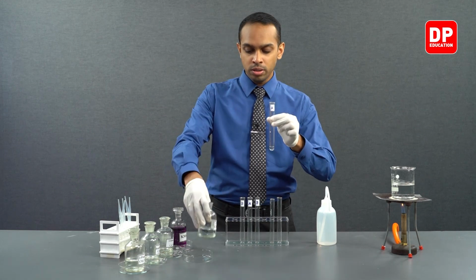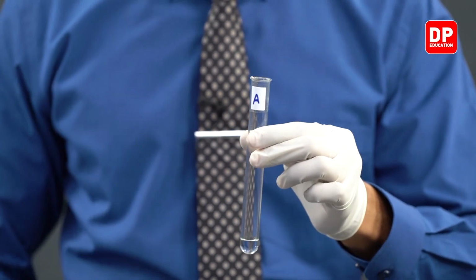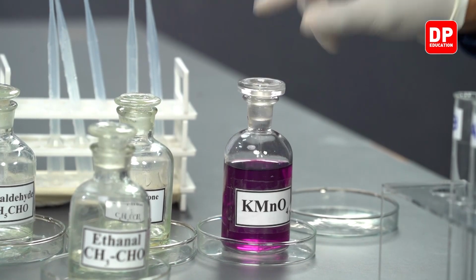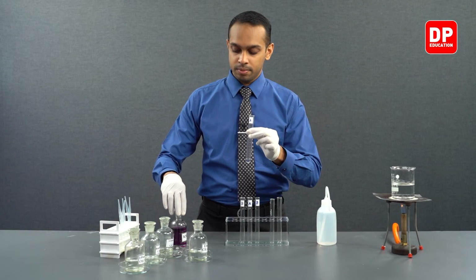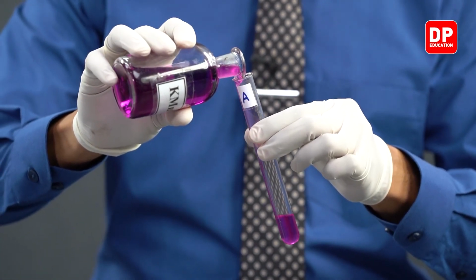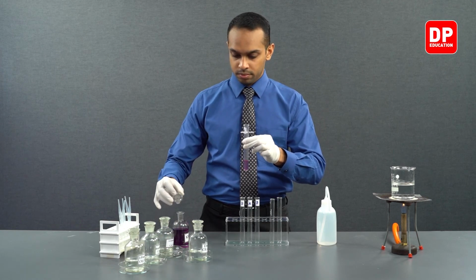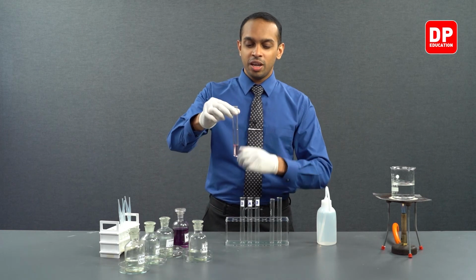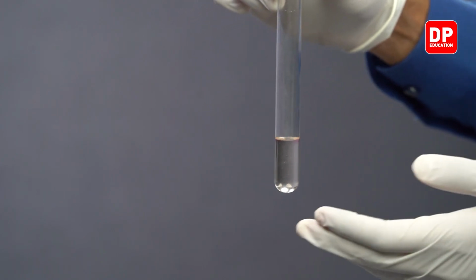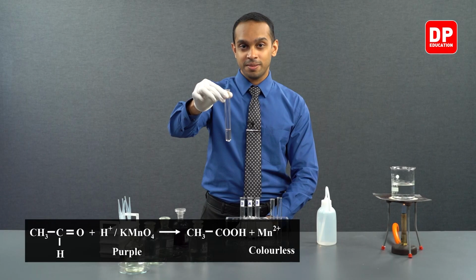We only need to take a small amount. And to this, we will add acidified potassium permanganate. This potassium permanganate is acidified. As you can see, upon addition of acidified potassium permanganate, very quickly the solution is turning colorless.